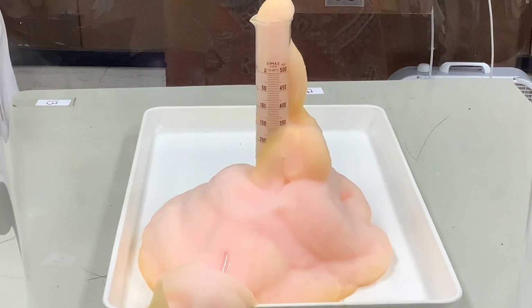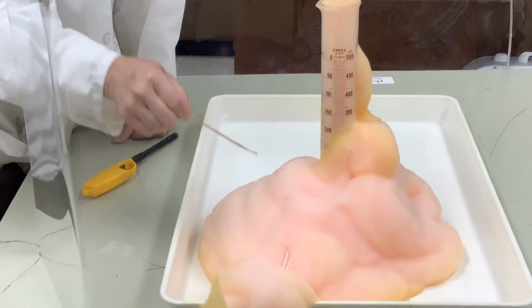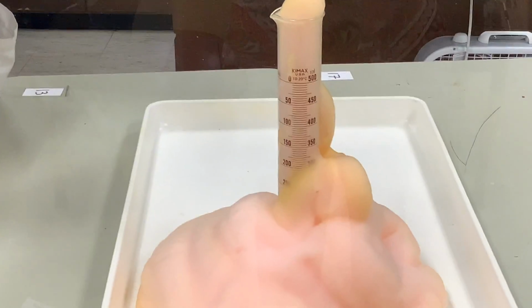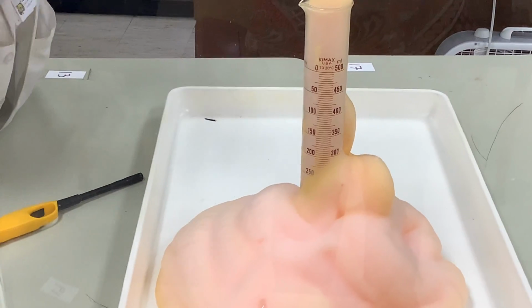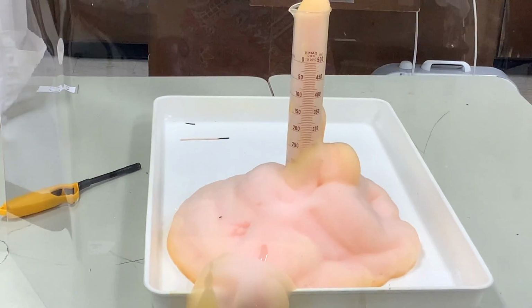plain wooden splint and relight it. You can see it flare. Relight it sometimes by picking up the oxygen in the bubbles. You can at least see it flare. There, it relit for a second. Unfortunately, the bubbles are wet, so it puts it back out. But those bubbles are filled with oxygen, and that is the famous Elephant's Toothpaste Lab.